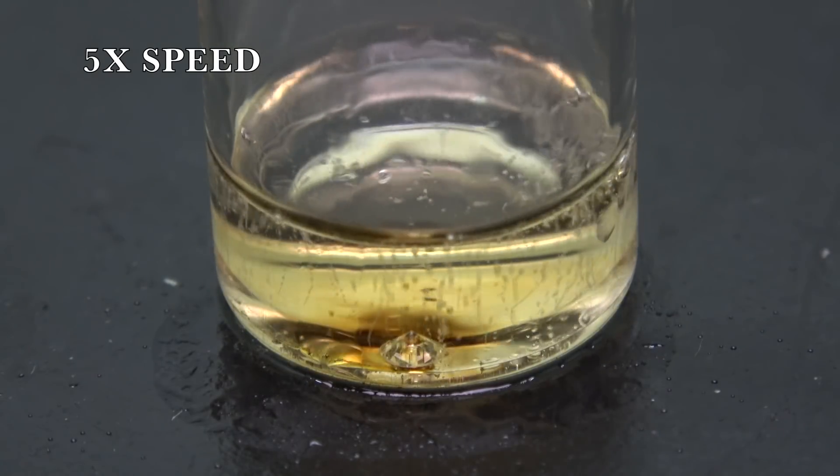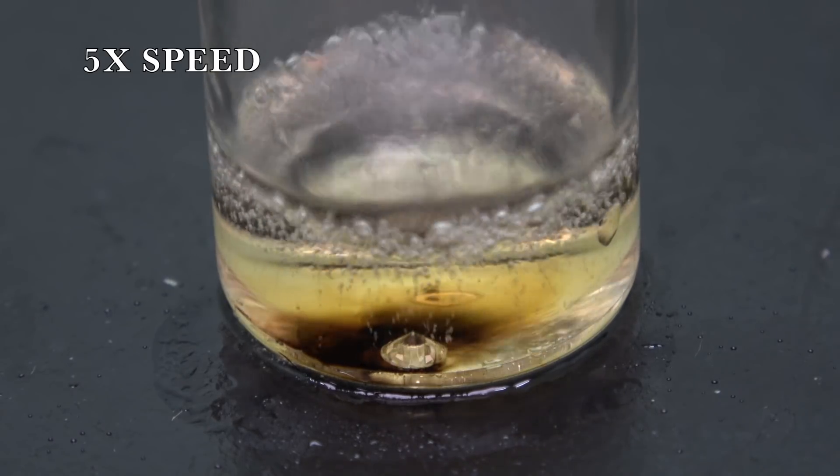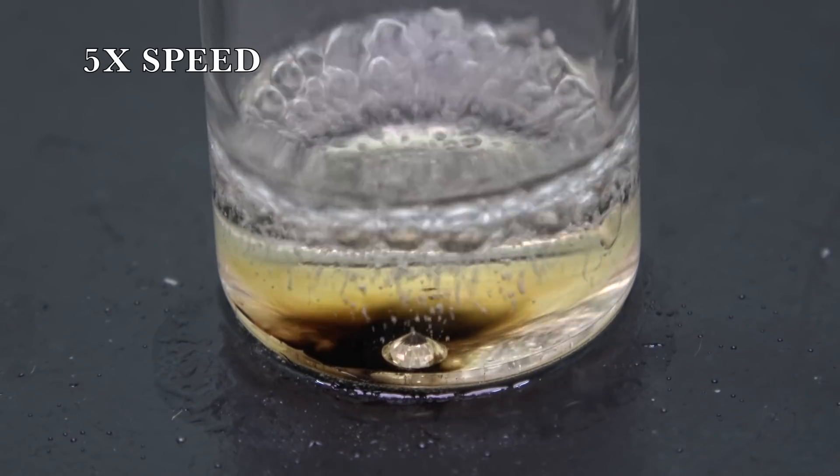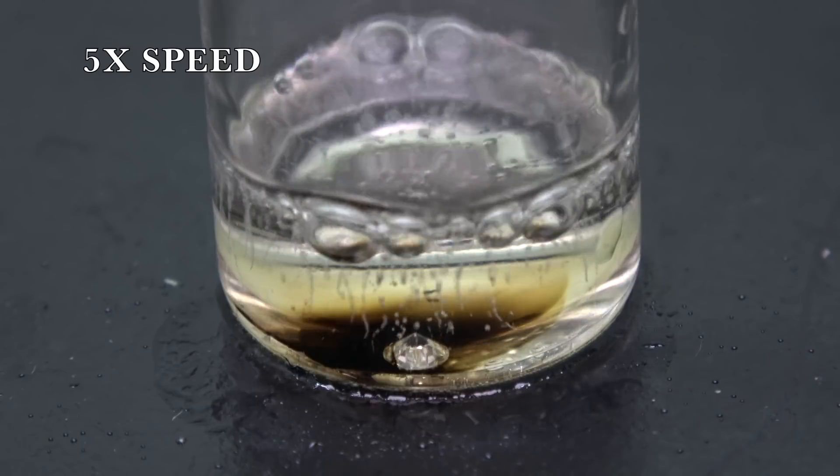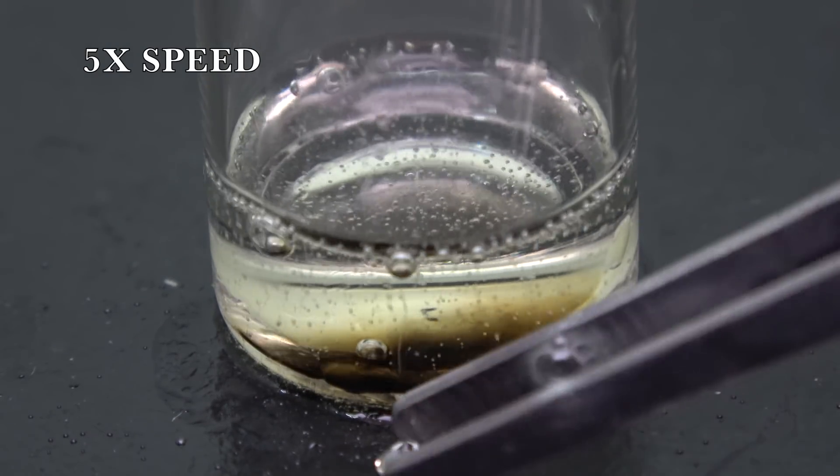Okay, here's the thing. At the time that I was doing the experiment, I thought the carbon around the diamond was just carbon from the glucose that hasn't been fully oxidized to carbon dioxide. And I stopped the experiment. But when I was editing this video, I realized that was not what I thought.